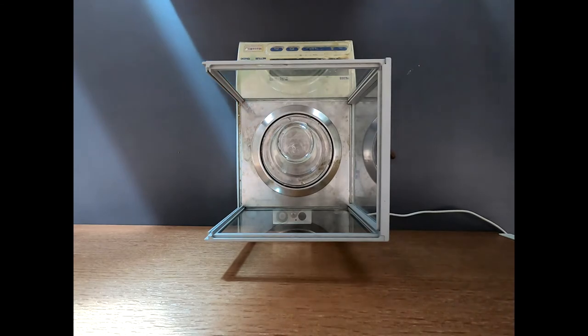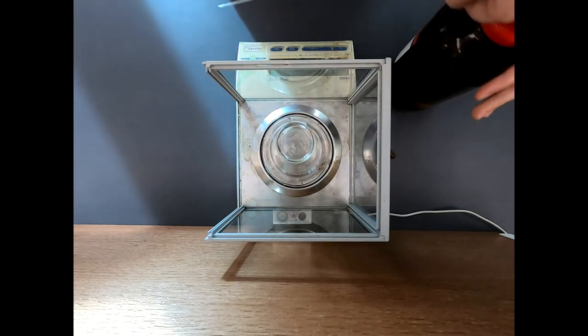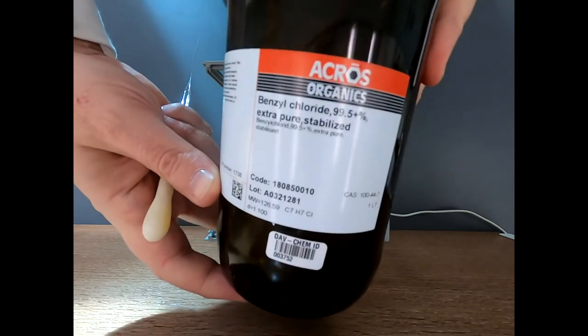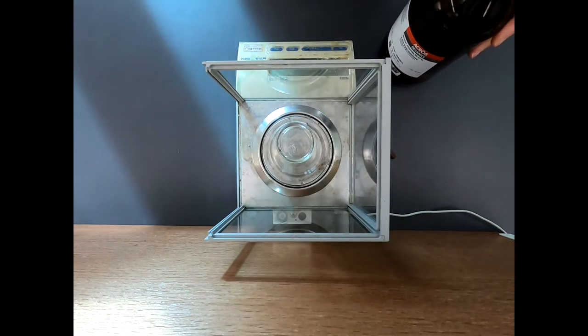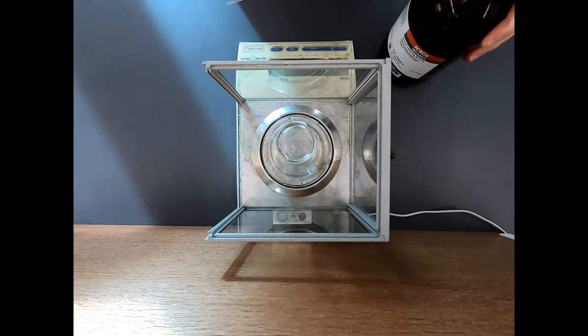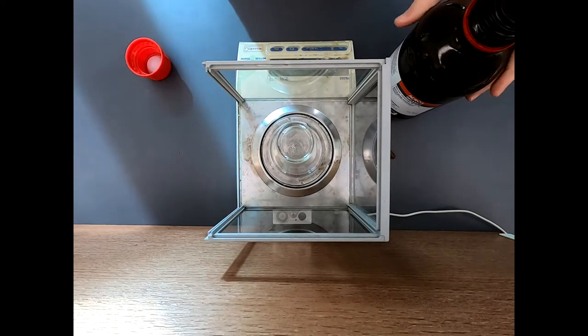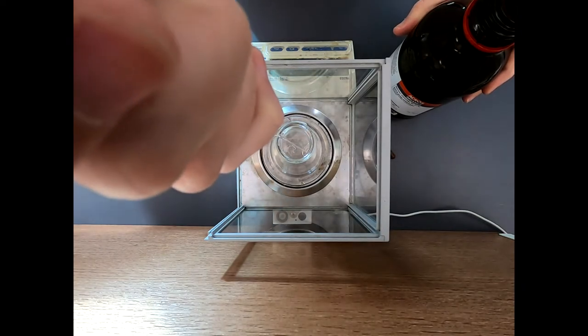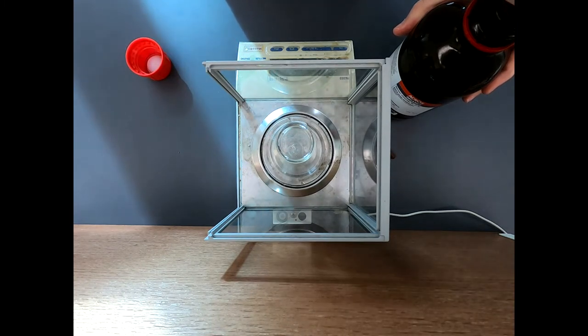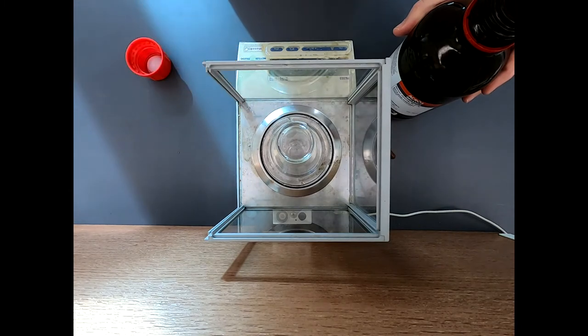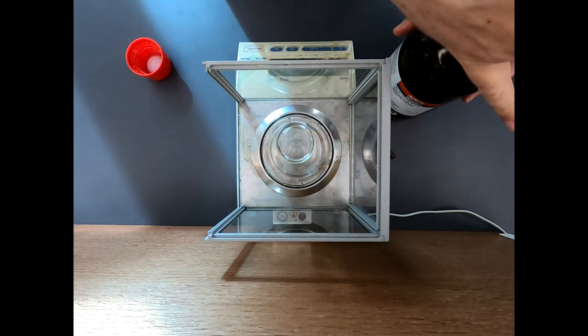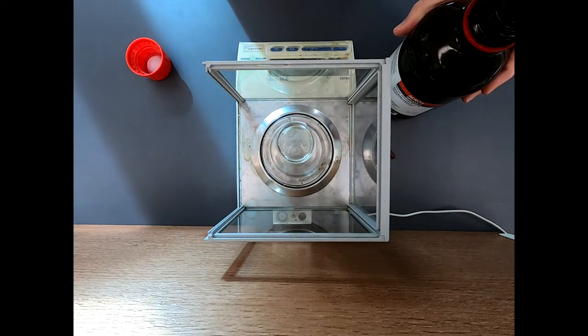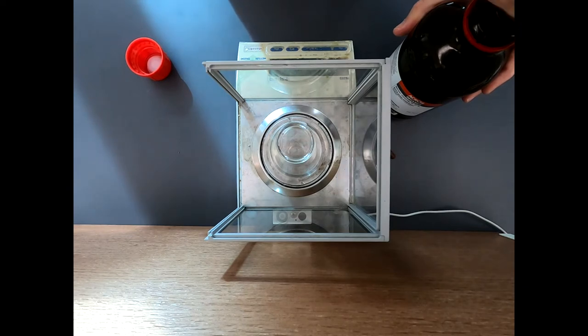So let's begin to weigh out some of our reagents. I say some. There's two reagents. So the first is going to be benzyl chloride. This is a big bottle of benzyl chloride. Benzyl chloride is not a bad reagent, but very often people will work with benzyl bromide instead. Benzyl bromide will empty a laboratory. It's a very potent lachrymator and will cause you to cry. If it's spilled in a lab or used sloppily in a lab, you really can't work in there because it will really bring literal tears to your eyes. Benzyl chloride is kind of the little brother of benzyl bromide. It's just simply not as reactive because that chloride is not as good of a leaving group.